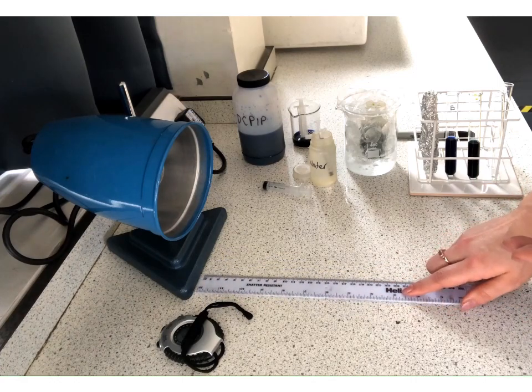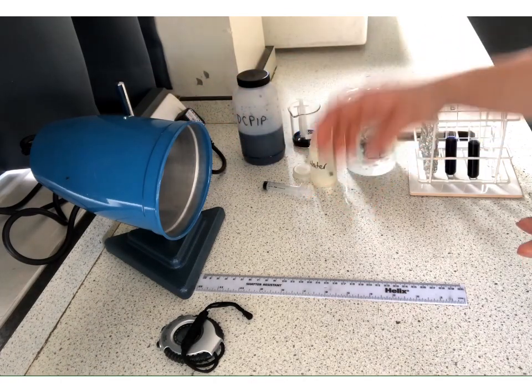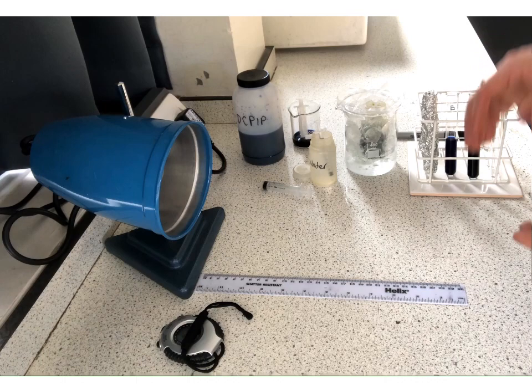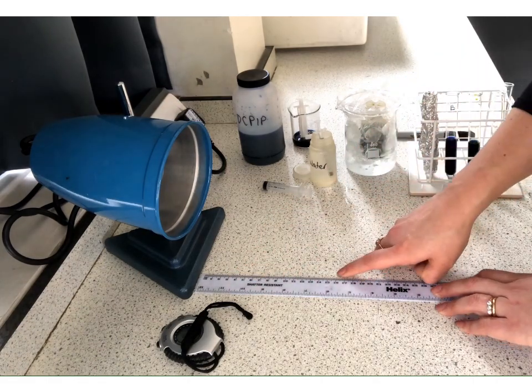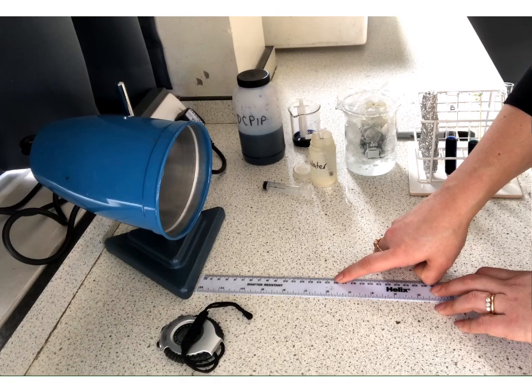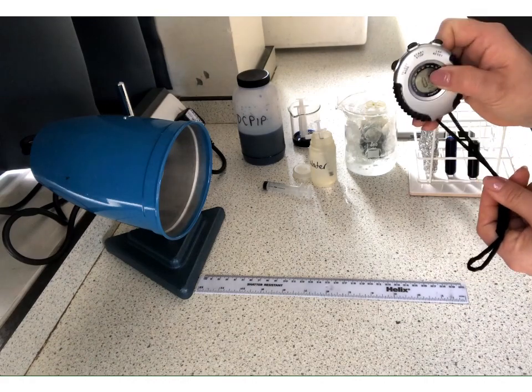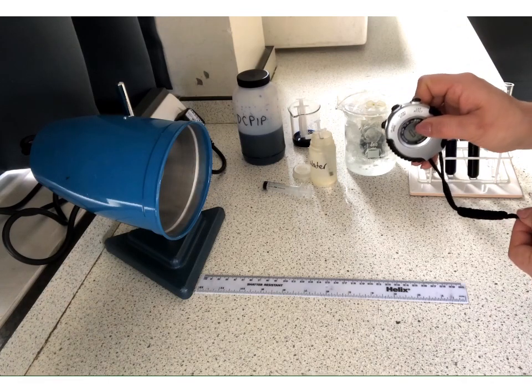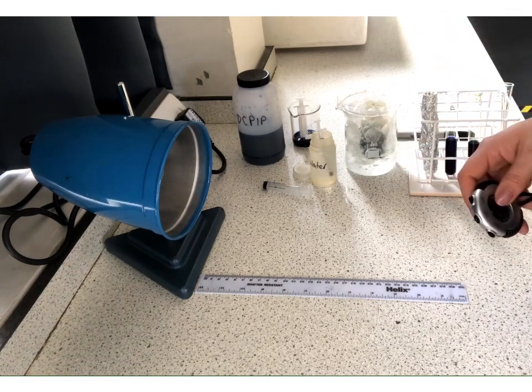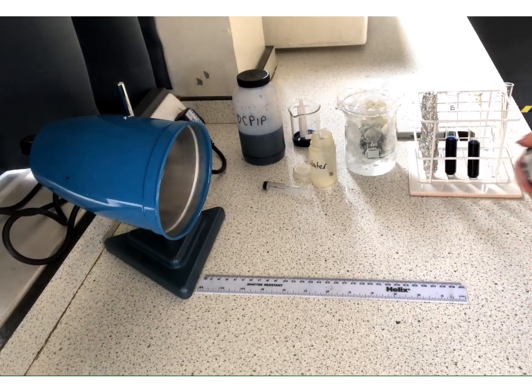We can take repeats if we wish, but we are essentially going to place the lamps at the light source 5 centimetres away from one of our test tubes, which will obviously be a higher light intensity because the light is closer. And then for the second one, we are going to have the lamp 10 centimetres, so double the distance away from the light source. So that should make the light intensity lower. And then we are going to use our stopwatch to time how long each one takes to decolorize, and hopefully that will give us an idea of how the light intensity is affecting the rate of photosynthesis, so the time taken for the DCPIP to reduce.